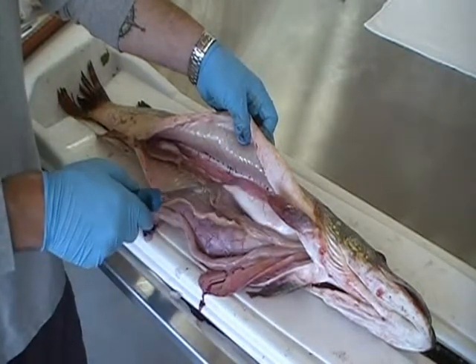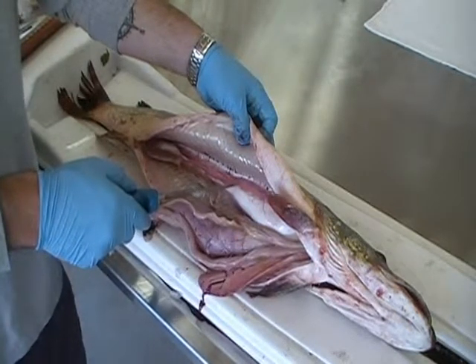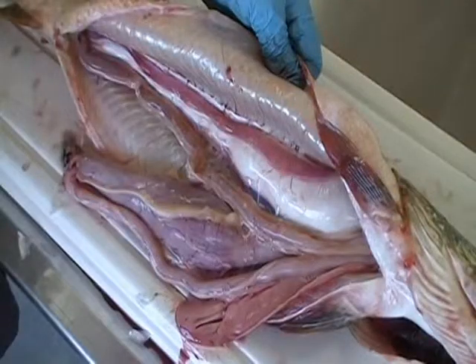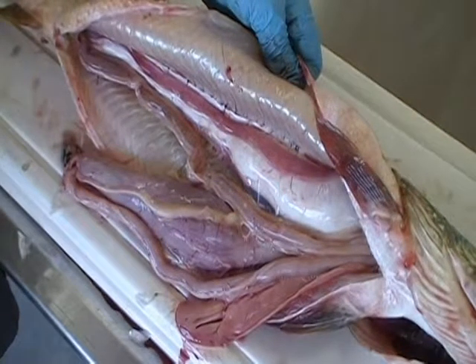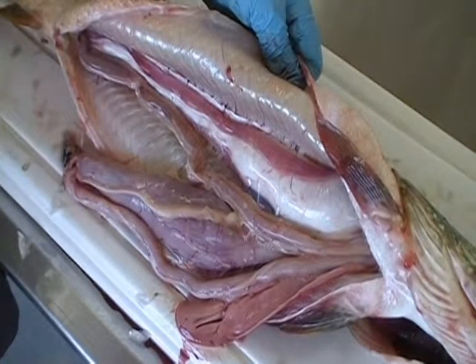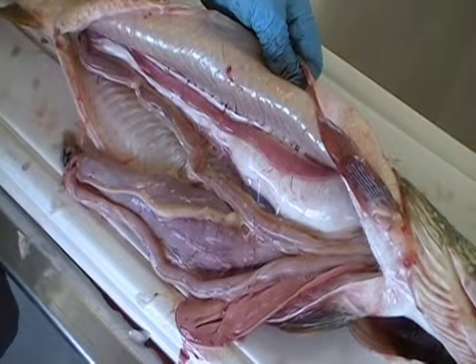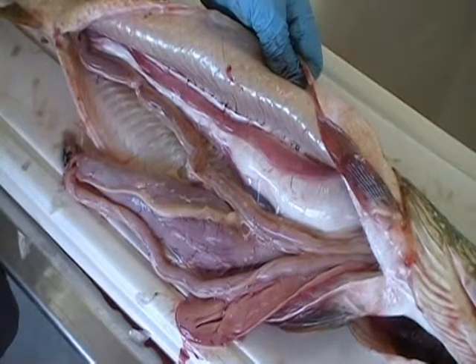This is a mature female — this fish would have spawned in the spring. The gonad is fairly pink in color with many veins coming down. It is also quite loose and what we term flaccid. It is quite soft and translucent. And if you look very closely, you can almost see residual or leftover eggs that are left in the ovaries from the spawn.